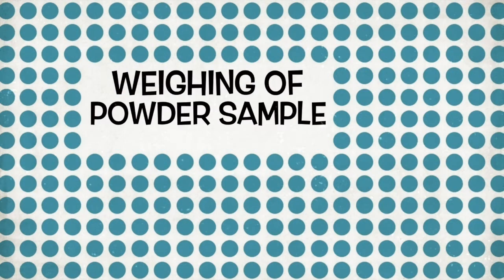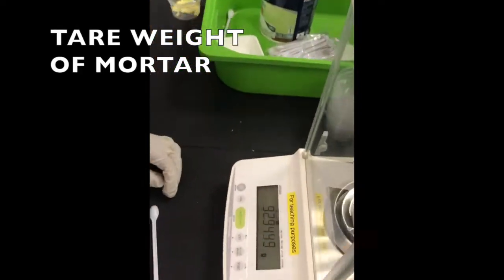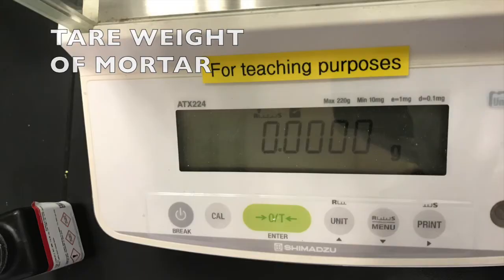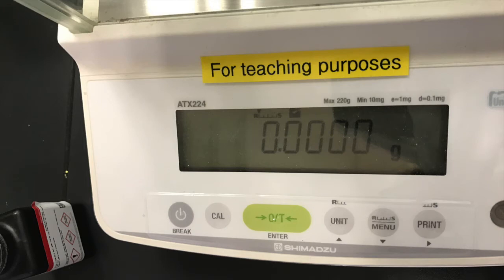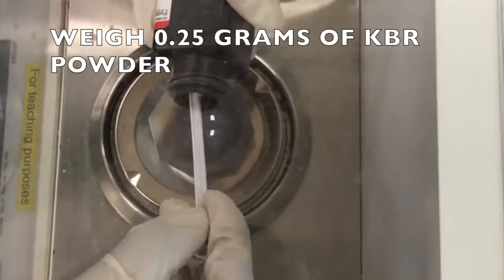Tare the weight of the mortar and weigh the KBR and sample powder. According to ASTM E1252, the ratio of the sample to KBR powder should be in the range of 1:50 to 1:1000 depending on the type of sample. In this experiment, we are using 250 mg of KBR with 1.5 mg of sample.